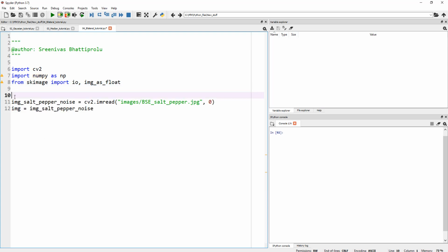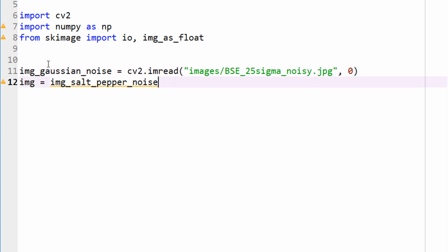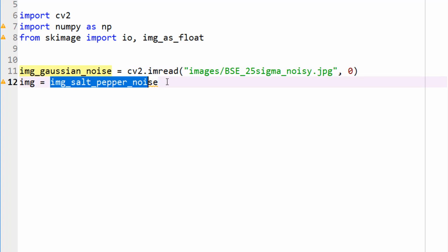And let's import our image. Let's actually, instead of salt and pepper, let's import a Gaussian image. Okay, so Gaussian noise image, where I artificially added like 25 sigma of Gaussian noise, and I think I called it 25 sigma noisy.jpg. Okay, so let's import that image, and I'm going to assign this as img, which makes it easy for me to type later on.